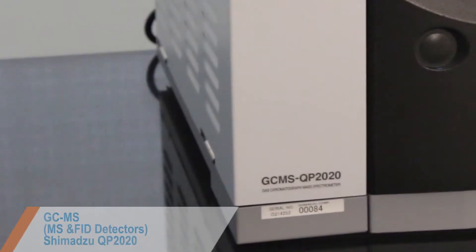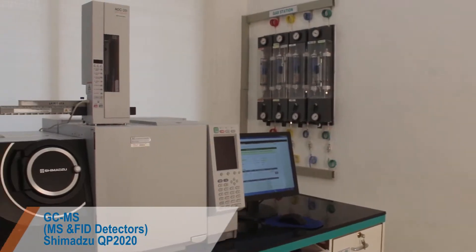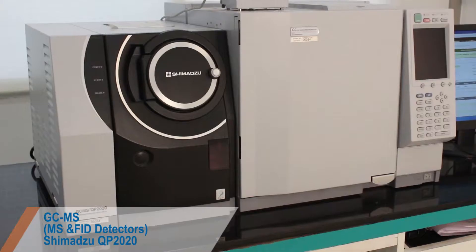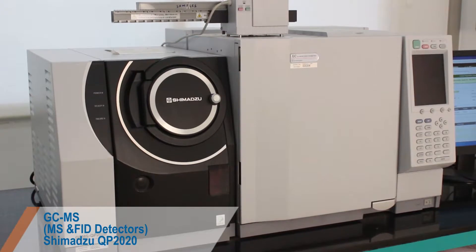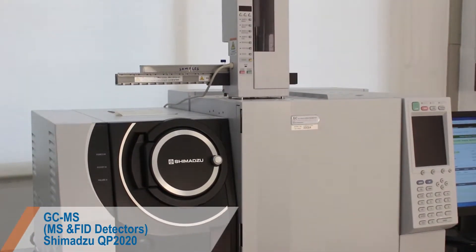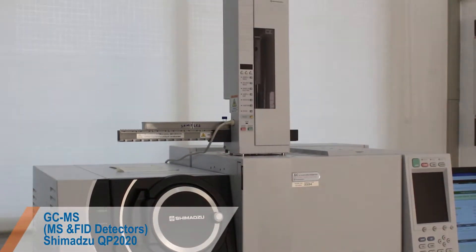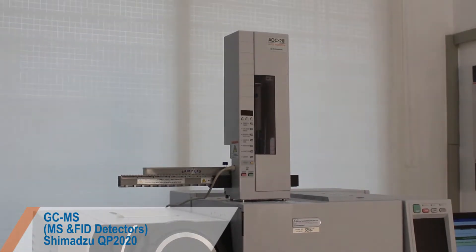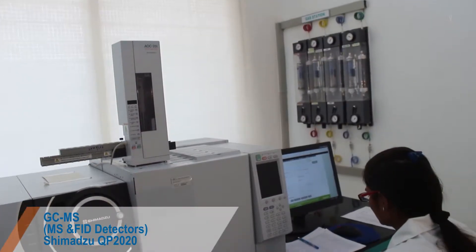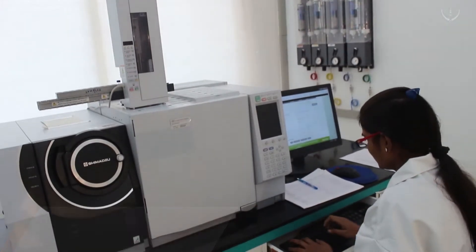Separation technique for quantitative and qualitative estimation of volatile components, identification of unknown peaks, genotoxic impurities, analysis of solvents, leachables and extractables, etc., in pharmaceutical samples and environment gases monitoring.